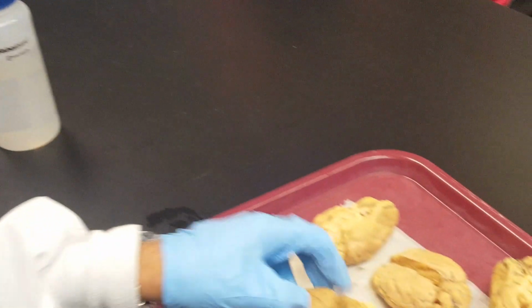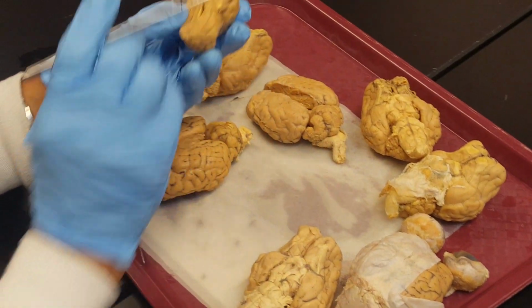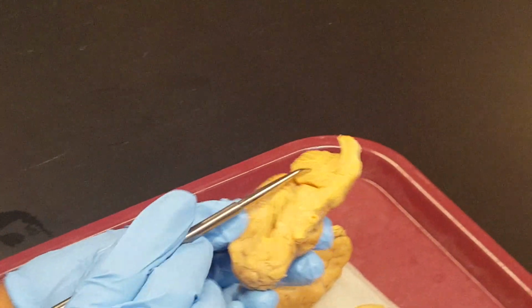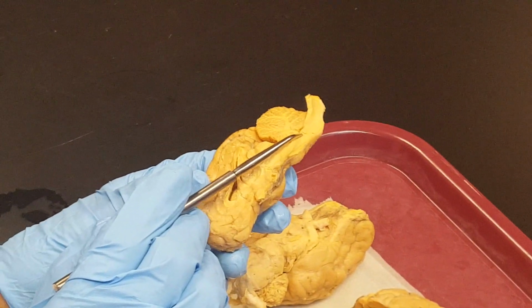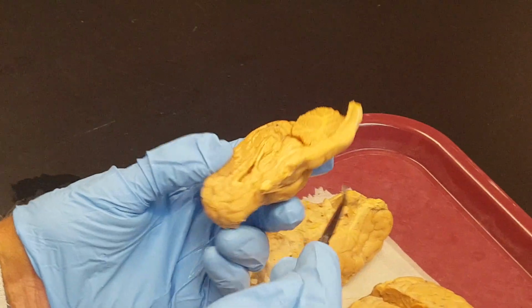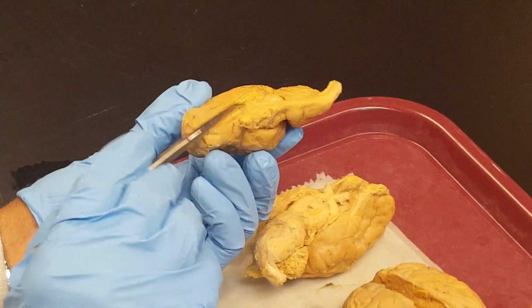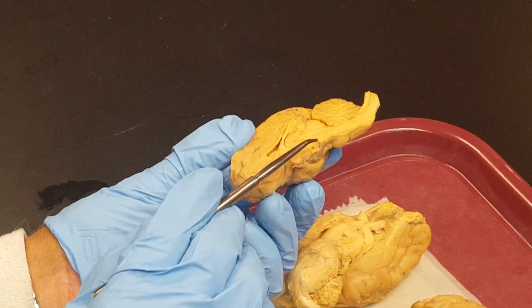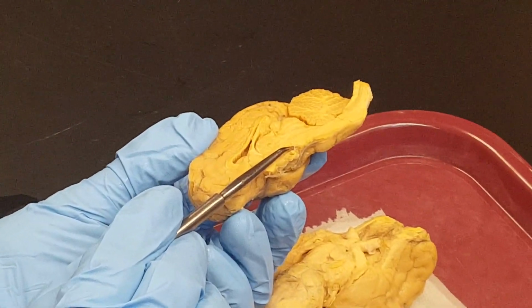Pineal gland, superior colliculi. You see the corpus callosum, the lateral ventricles you see, and this is cerebellum. When you cut through cerebellum, you can see the tree-like branching of the white matter. It's called arbor vitae. Okay? Now, this region is called the thalamus. This is the intermediate mass of thalamus. So this is hypothalamus. Thalamus, hypothalamus.